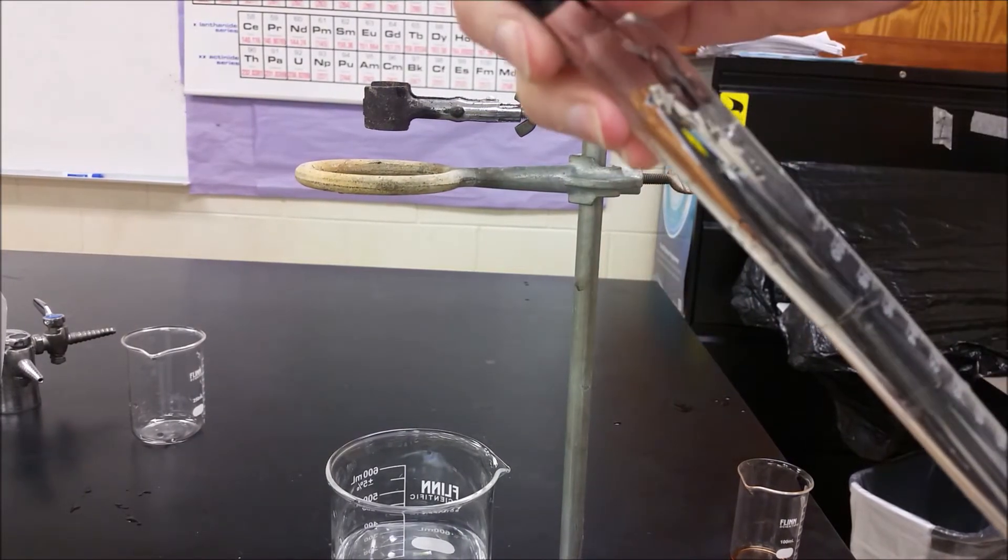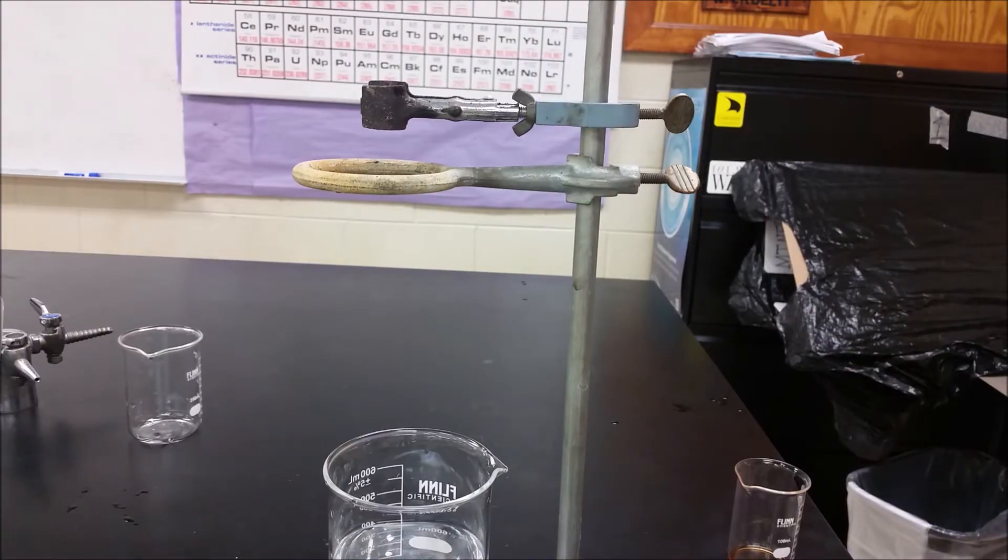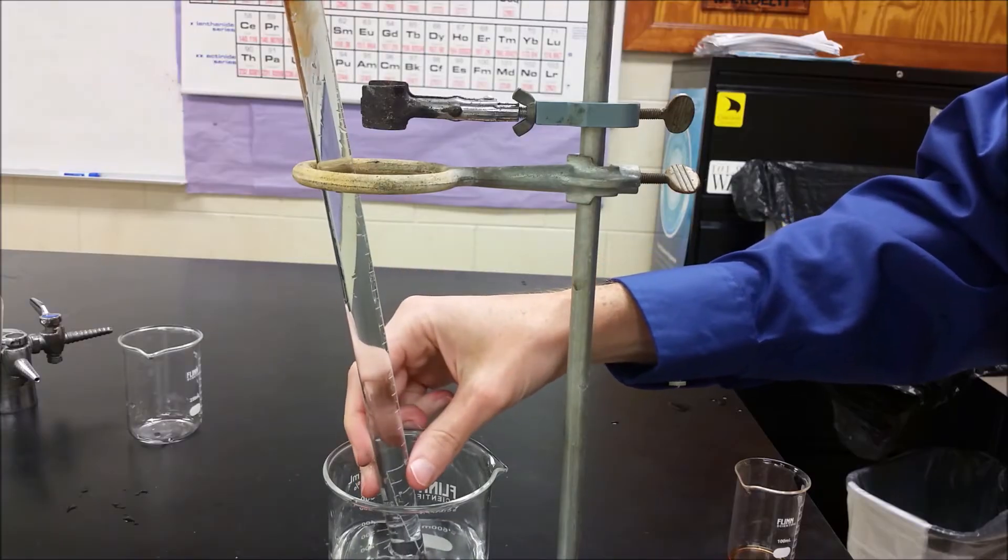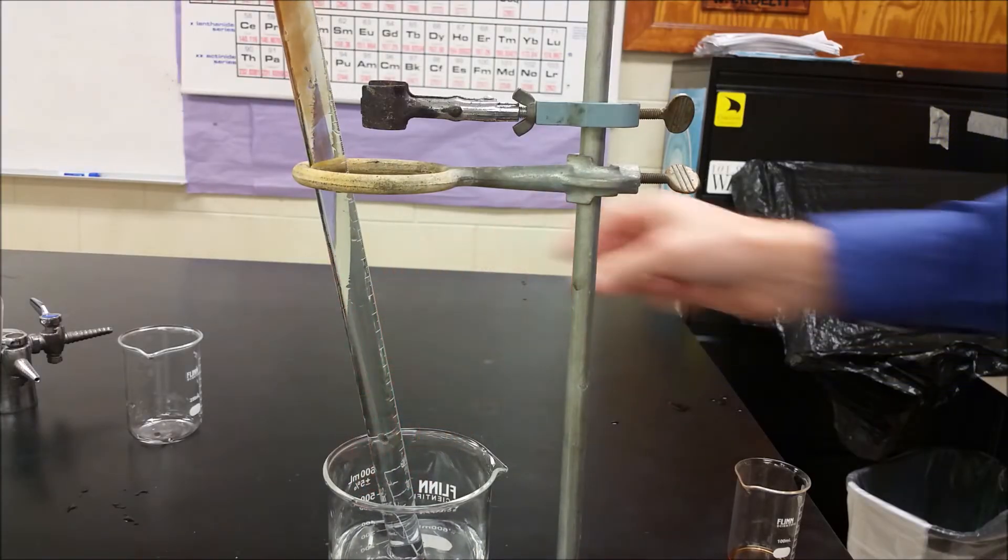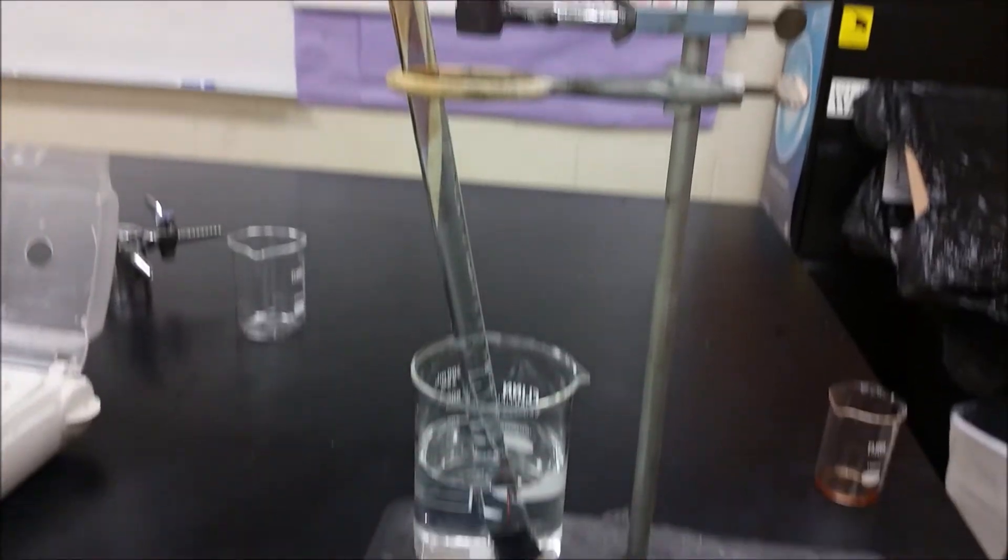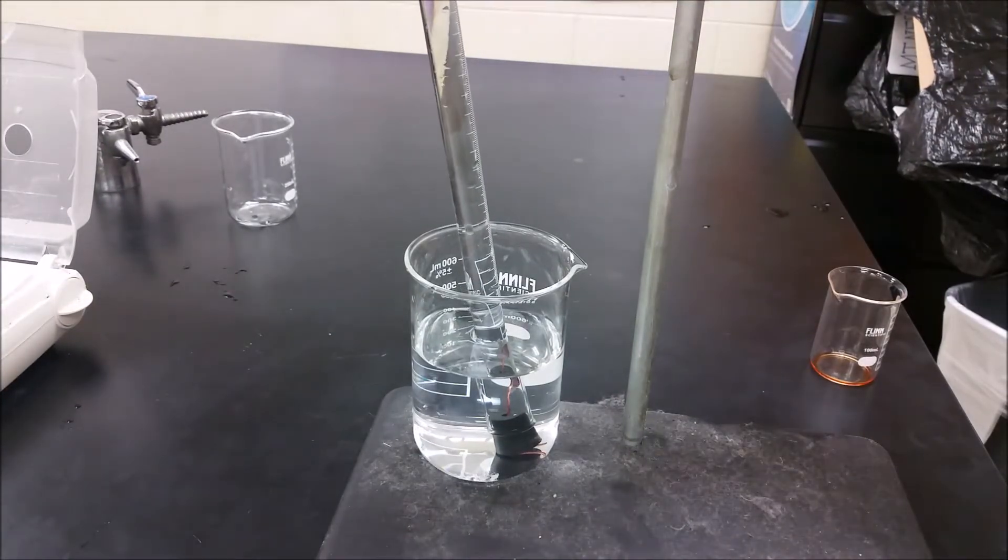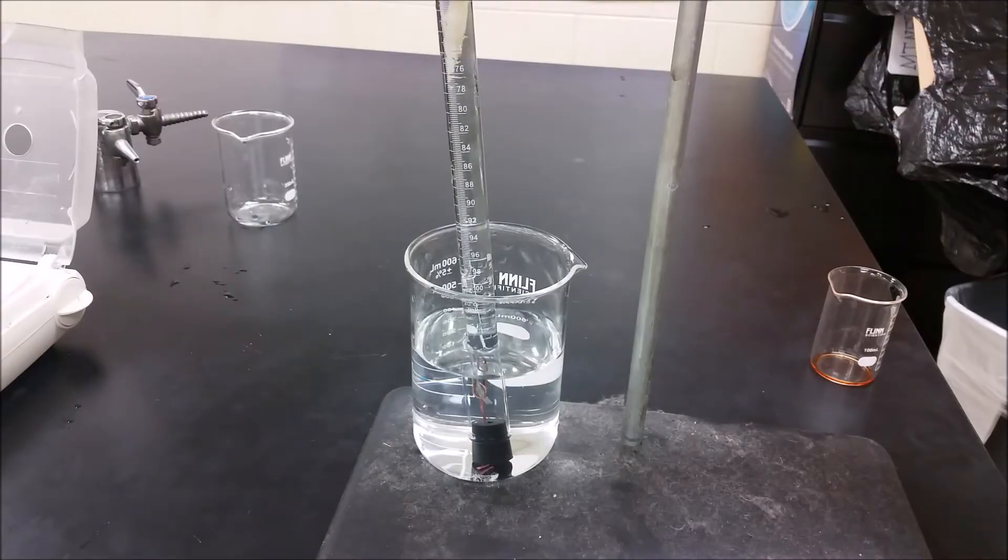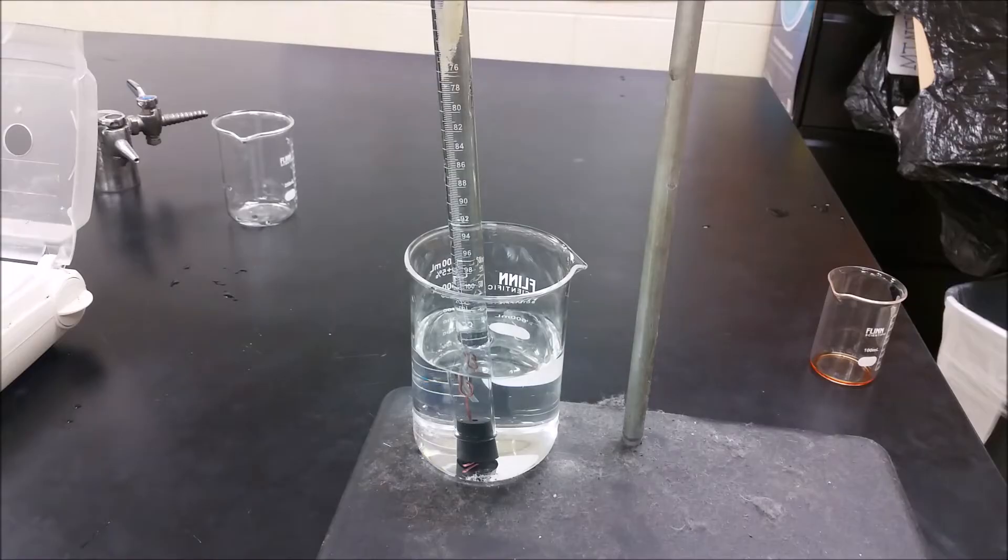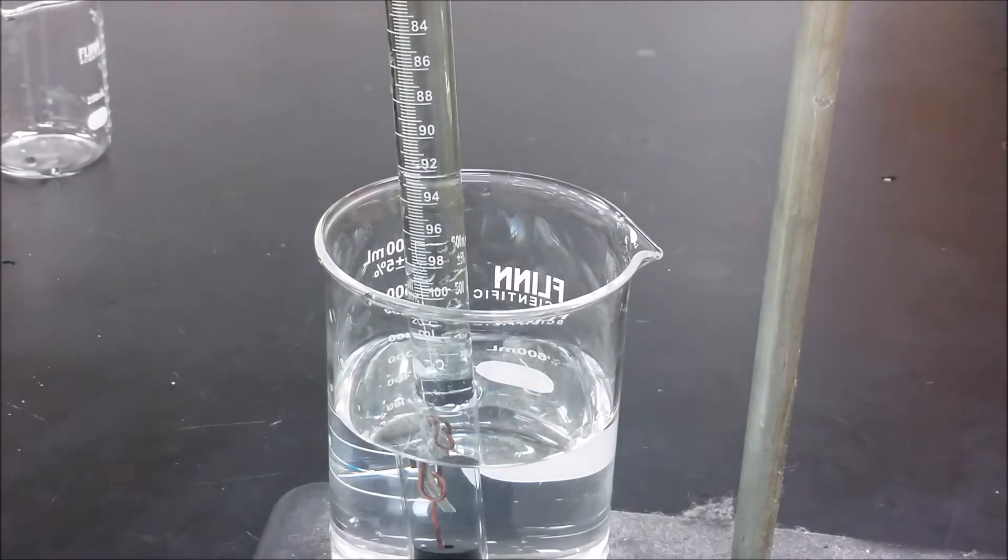We have the hydrochloric acid at the bottom, water at the top with the stopper. We're now going to flip that upside down. As the hydrochloric acid - you can see that red color kind of moving down towards the magnesium - and what happens is as that hydrochloric acid slowly mixes, it ends up reaching the point where it gets the magnesium. When that happens you start to see bubbling, and as those bubbles go to the top it pushes the hydrochloric acid mixture even further down and the reaction continues to happen.